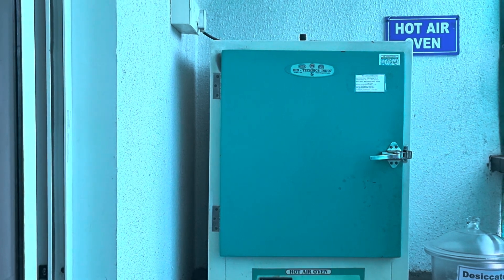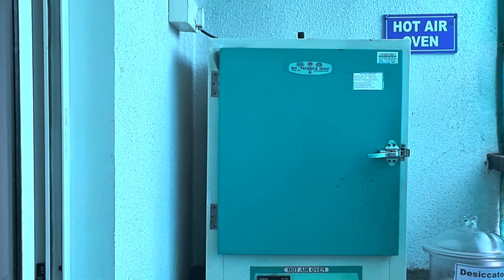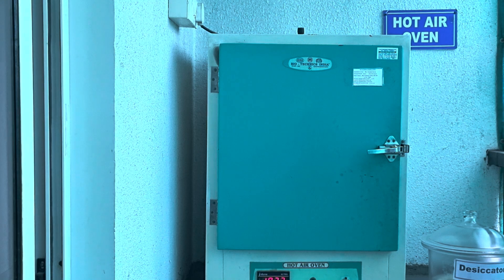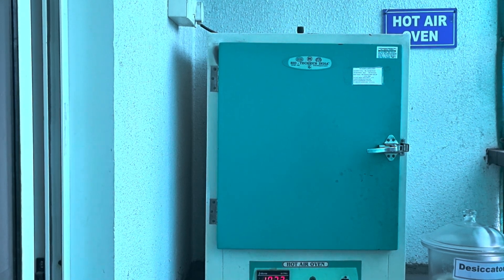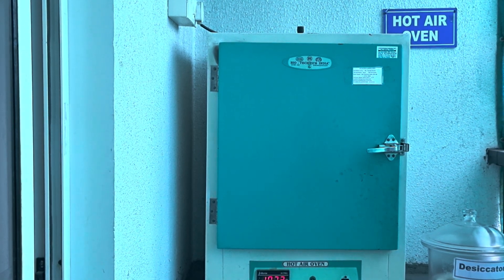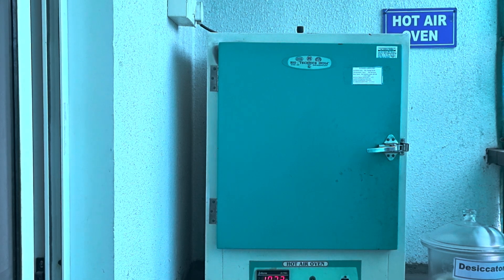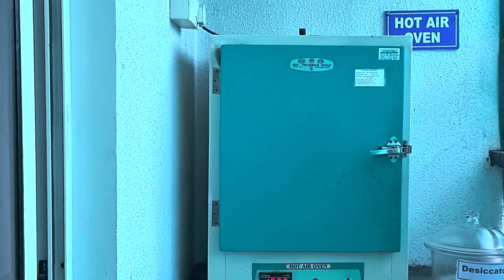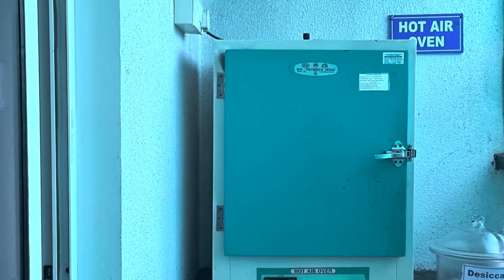Today, we will see about the total ash content in food products — how to estimate the total ash content from almost all food products. For that purpose, we will first introduce what is exactly the ash content.